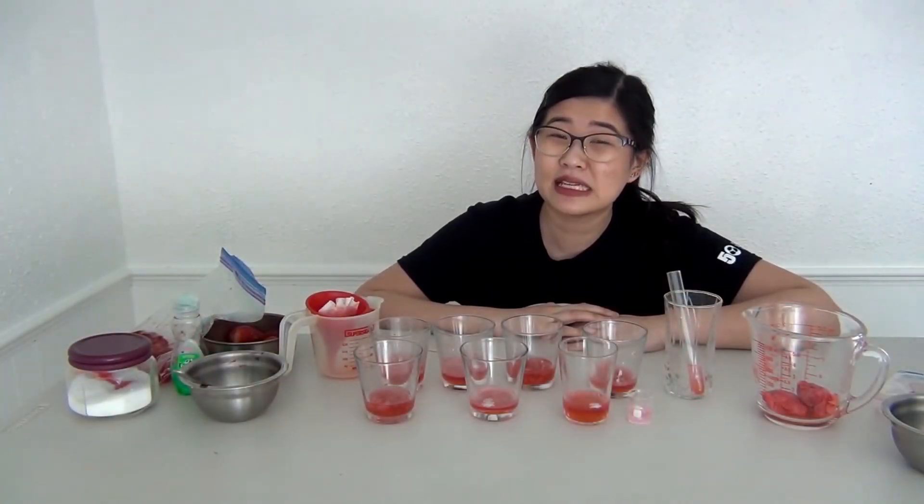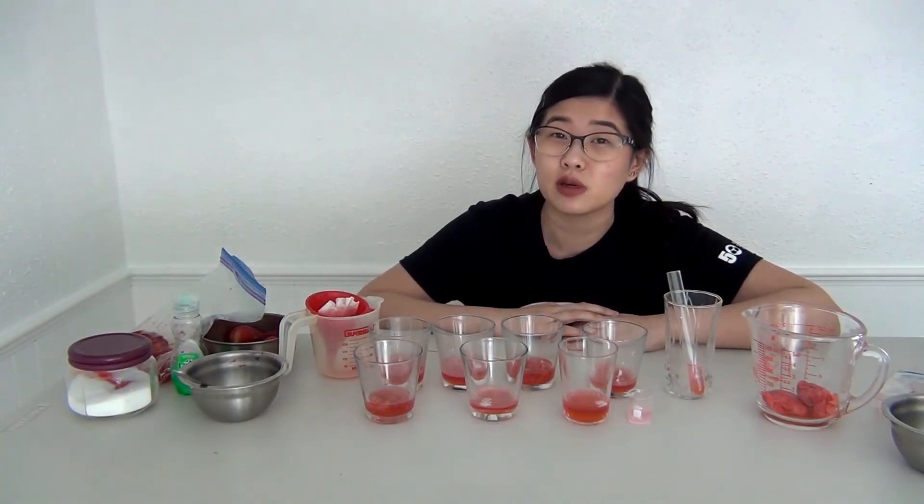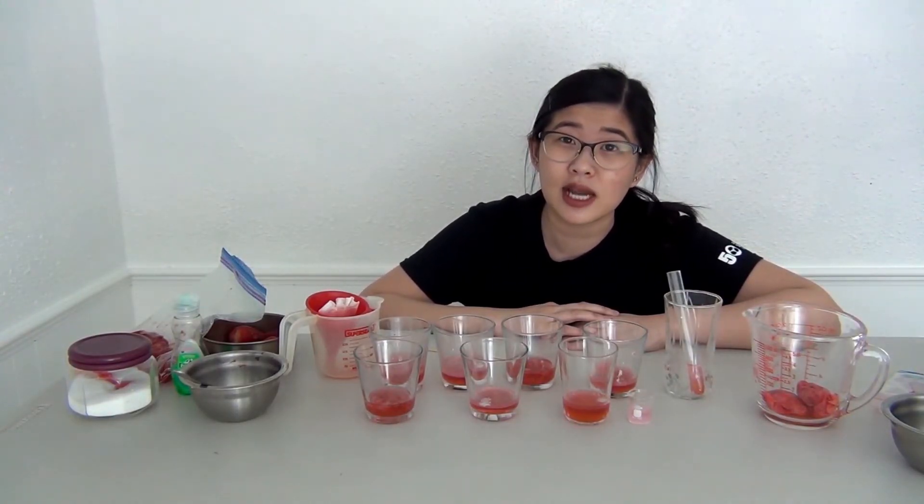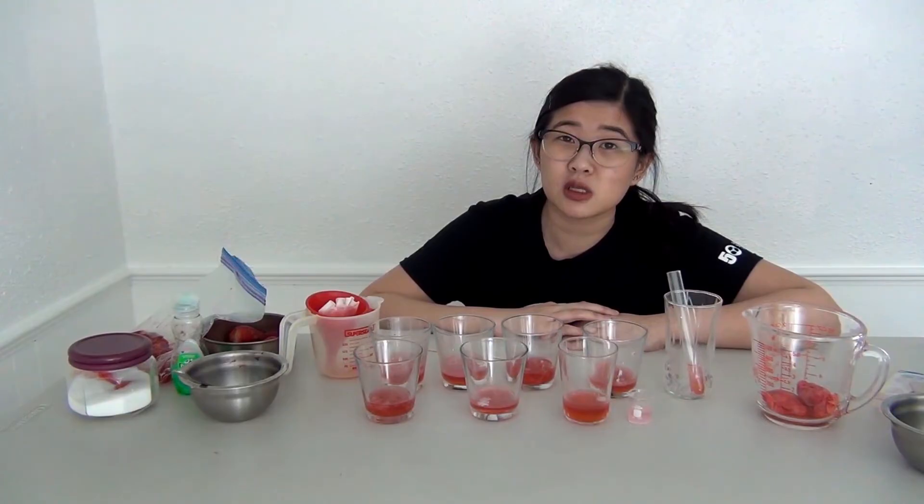Hey, so the experiment isn't done yet. You may have noticed there's a lot of room in the experiment to change up different things. We would like to challenge you to change a variable in the experiment with the goal of increasing your DNA yield or increasing the amount of DNA you get at the end of the extraction. We recommend doing a couple of things, doing some research about what each chemical does and taking some good notes about changes you make.